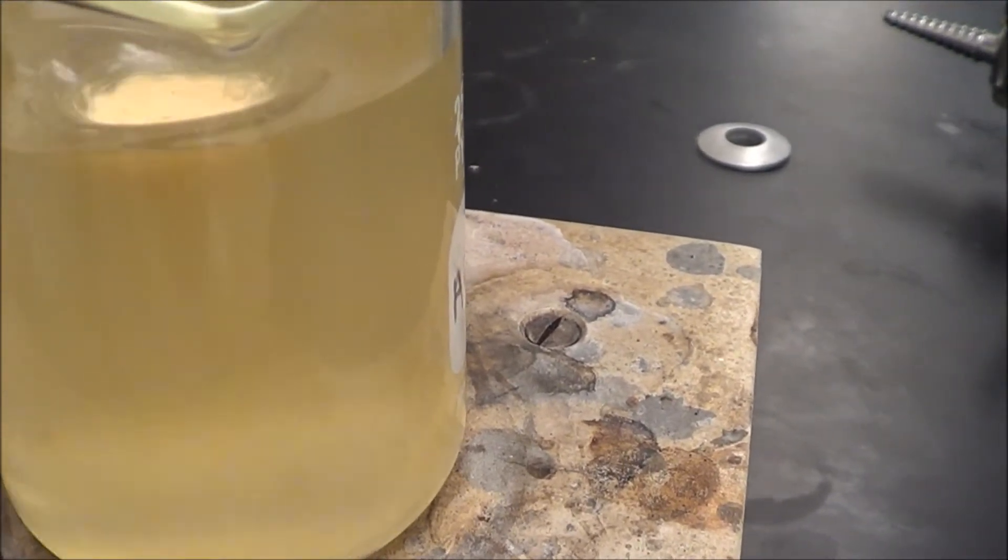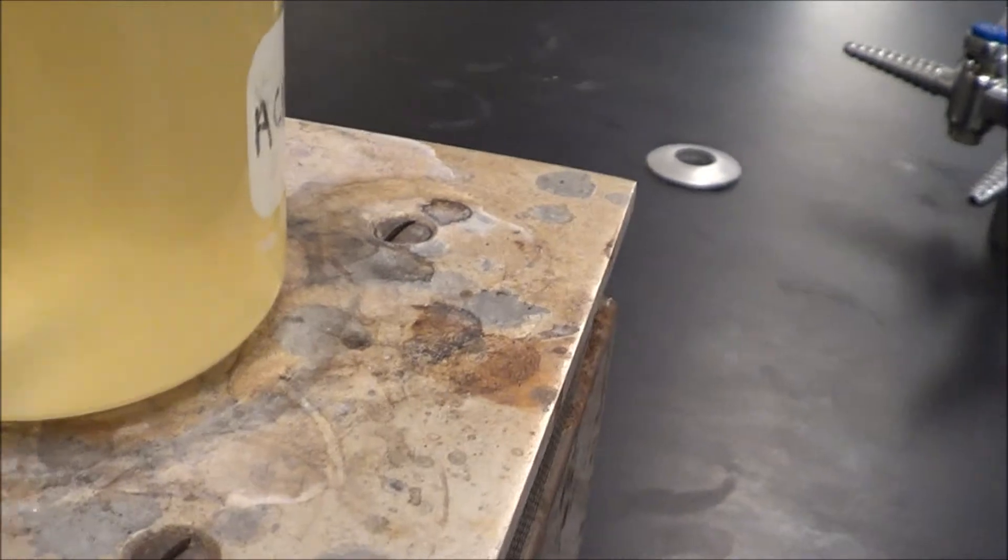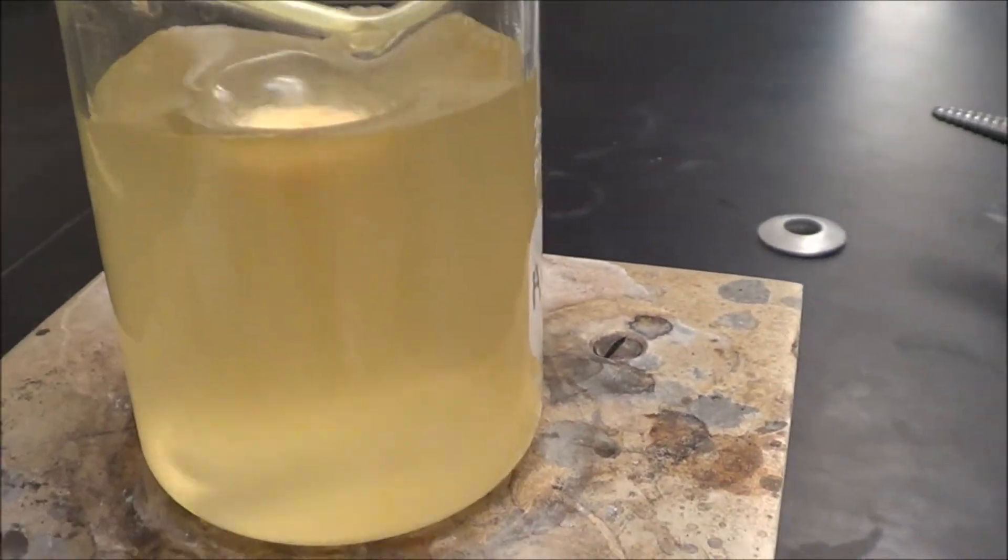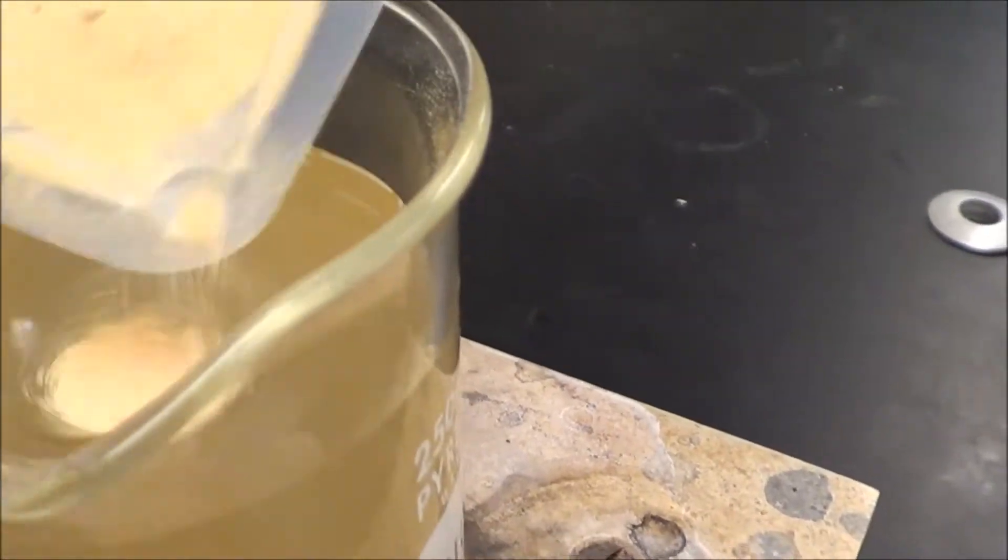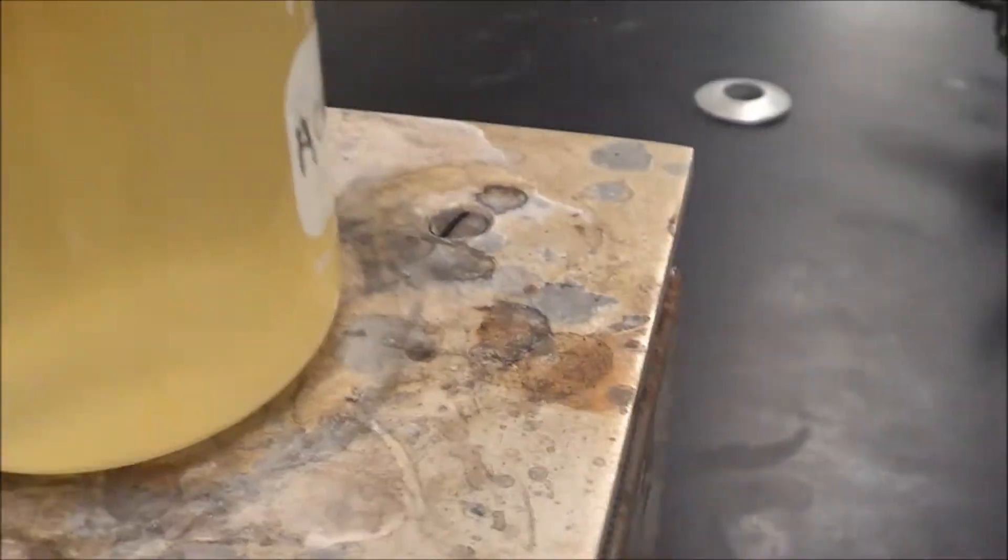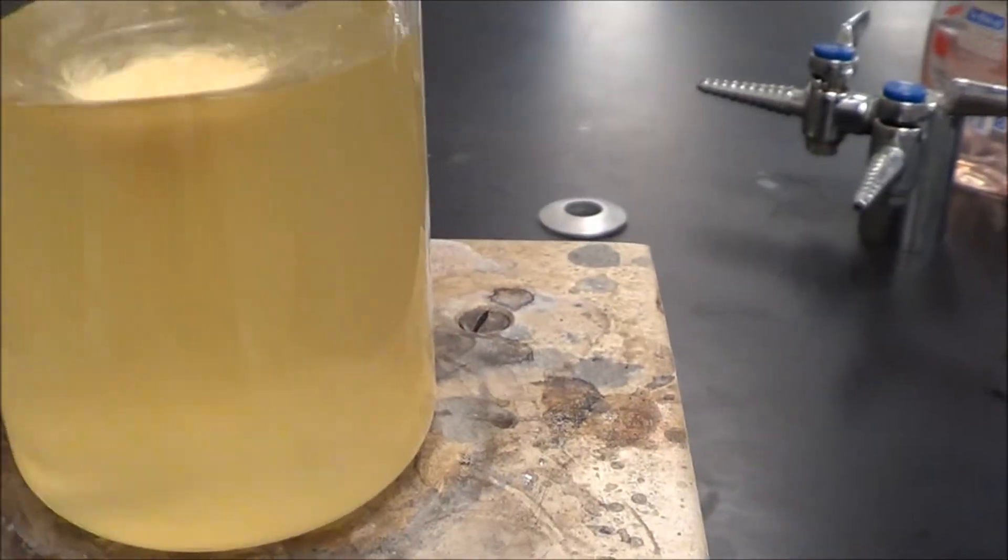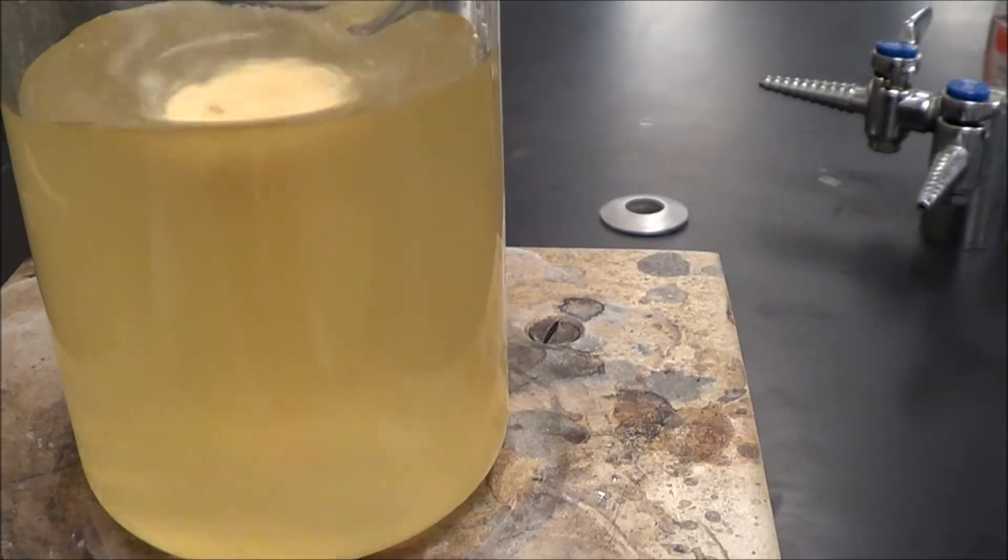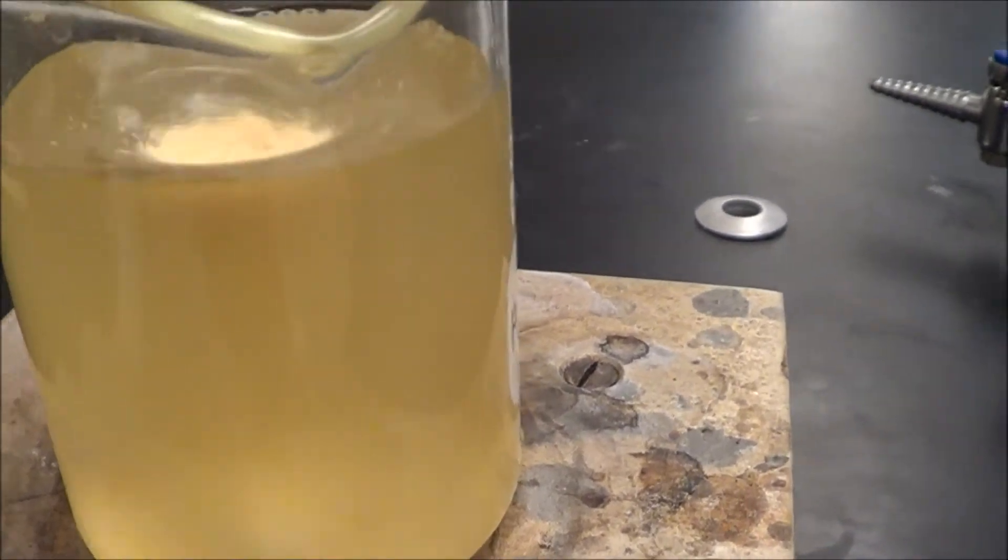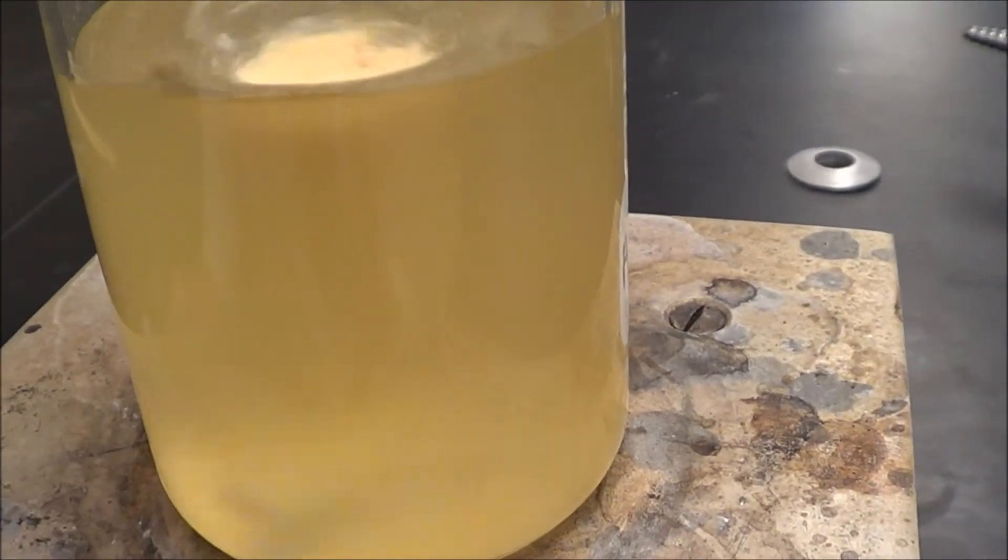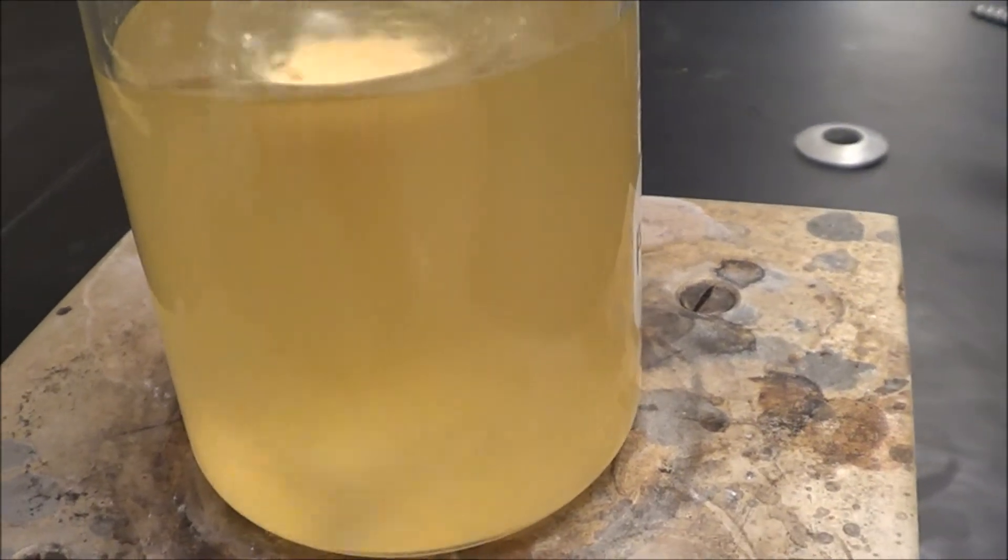And then, great, it's almost done here. A little more. Now this is going to get yellowy brownish at the end here. And eventually when we let it harden it's going to get thicker like jello.